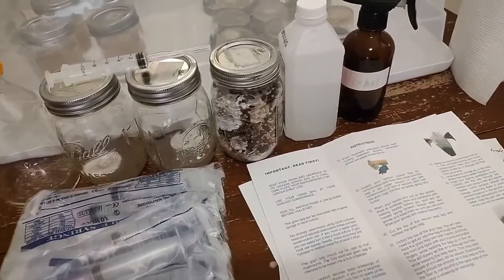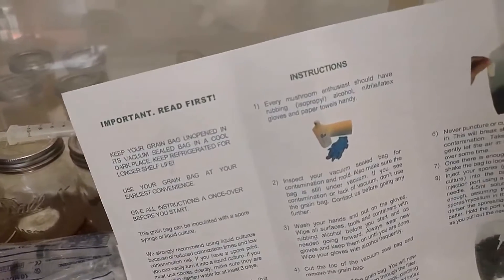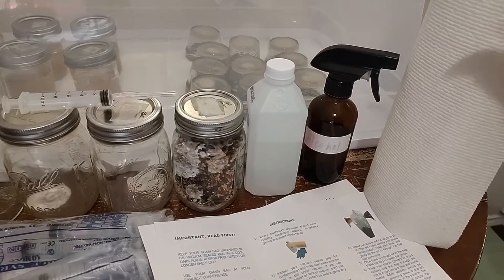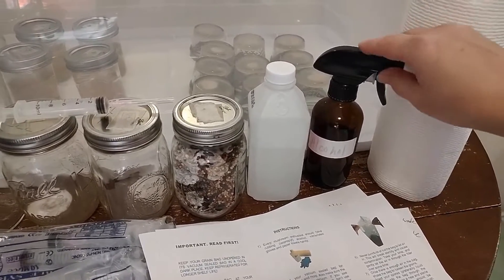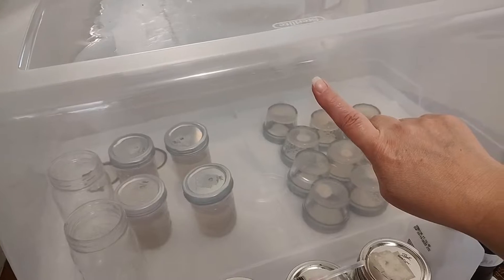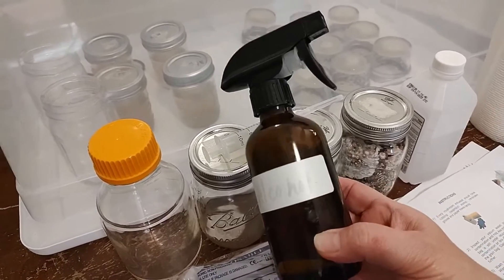We actually used a grow kit at the very beginning when we were experimenting and learning. The very first item on the instructions says every mushroom enthusiast should have rubbing alcohol, along with gloves and paper towels — and I agree. I cannot tell you how beneficial paper towels are to growing mushrooms at home. Everything needs to be sterile and clean. We've never even invested in fancy ventilation systems; we've always used a still air box, or SAB, and we have a video on how to create one. Everything we do is inside the SAB, and I'm constantly spraying everything with 91% alcohol.